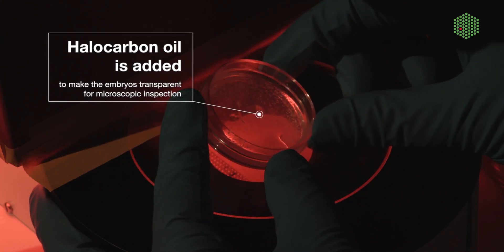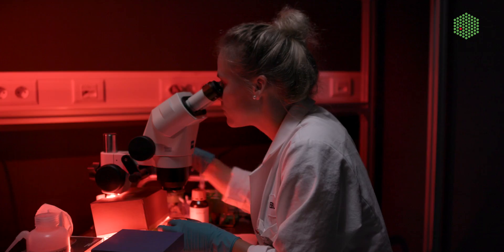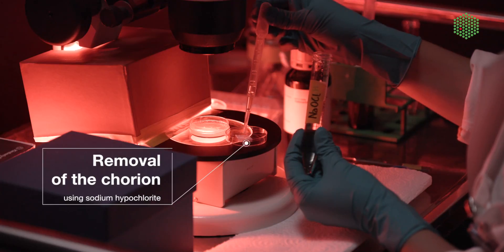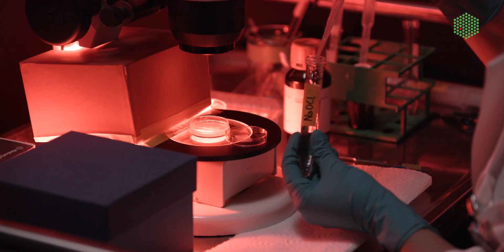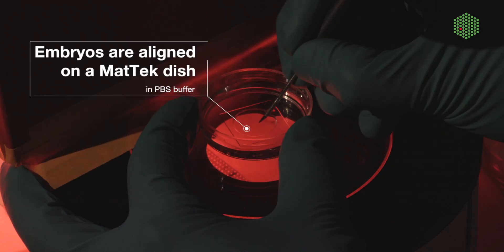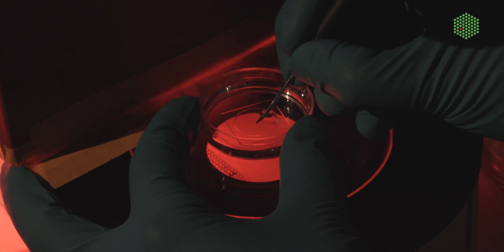Halocarbon oil is added onto the plate and embryos of the desired stage are selected. Next, the non-transparent outer shell of the fly embryo, the so-called chorion, is chemically removed using bleach. Finally, the dechorionated embryos are positioned and aligned on a Mattek glass bottom dish and the sample is placed on the stage of the microscope. To summarize the main steps of sample preparation: you start by cloning your optogenetic constructs, you then use those to generate transgenic fly lines, then you drive the expression of the optogenetic components in your desired tissue, which in our case is the Drosophila embryo, and then you mount your samples in the dark.